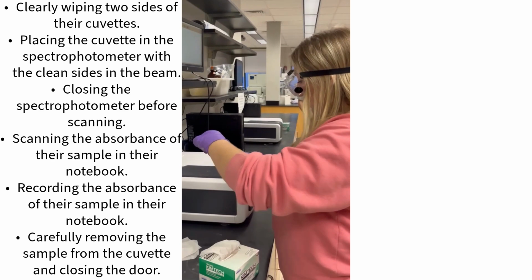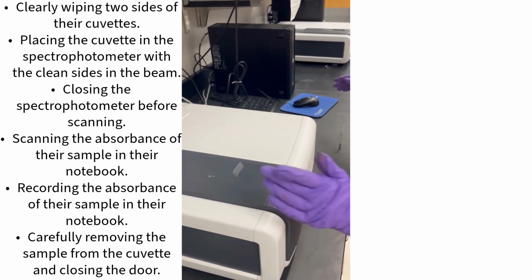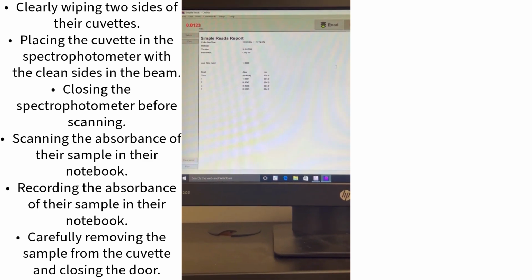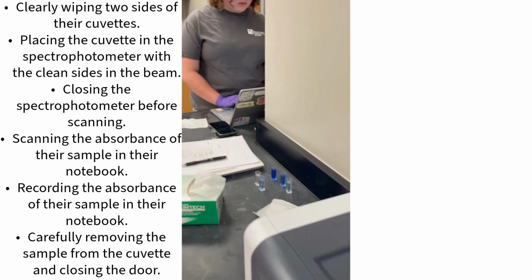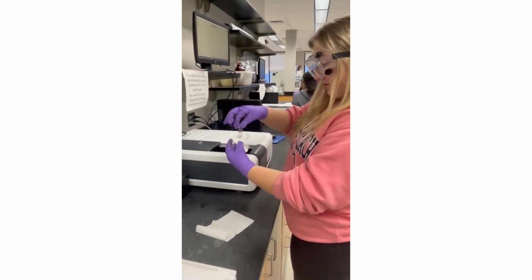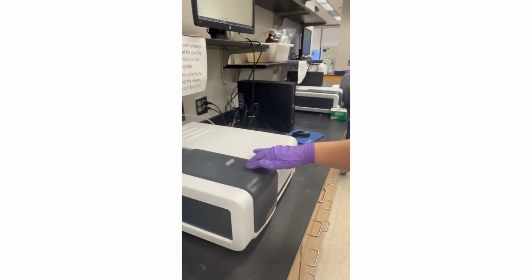Beer-Lambert's law states that there is a linear relationship between absorbance and the concentration of a sample. The equation is A equals epsilon L C. A equals the measure of absorbance, epsilon equals molar extinction coefficient or the molar absorbency, L equals path length, and C equals concentration. Epsilon is a constant and varies for each molecule.